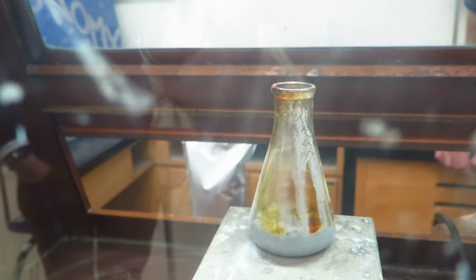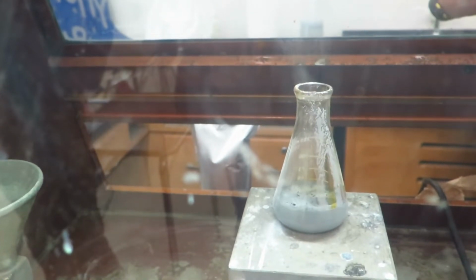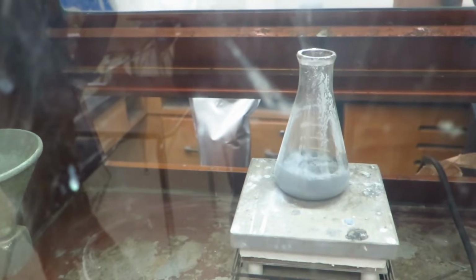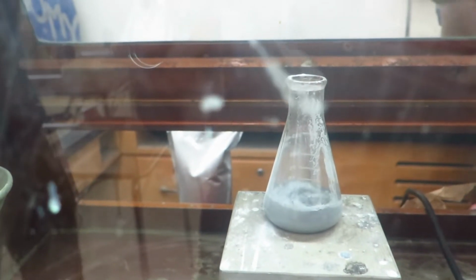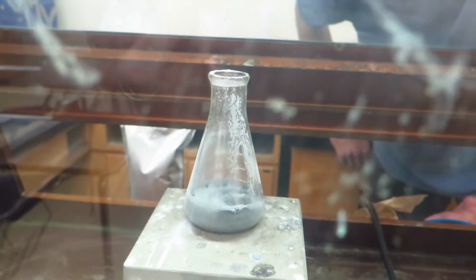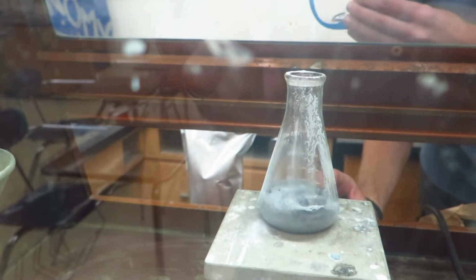Didn't know that the pigment would be so dark. If you haven't turned the hot pad off, just unplug it. Wow, that was really cool, honestly. That might be cooler. I mean, it was dangerous, but it was cool. There's like iodine bubbling up from... All right. Yeah, that was pretty quick. Just less purple, more black. Yeah. I think it seems to be over now.